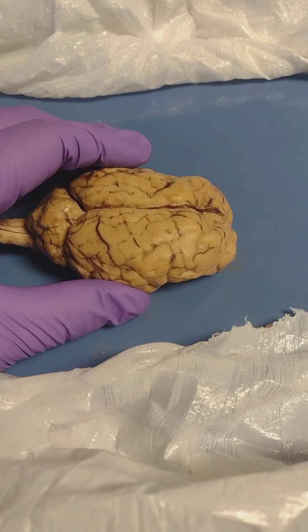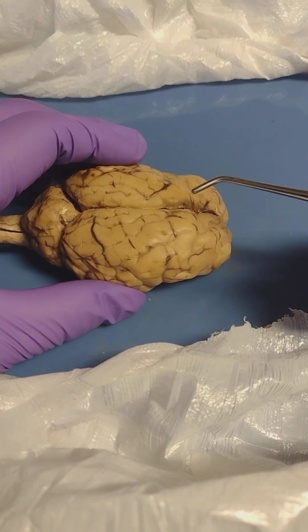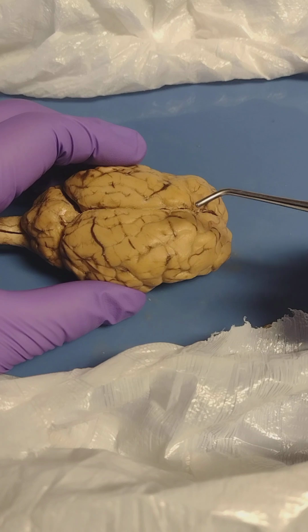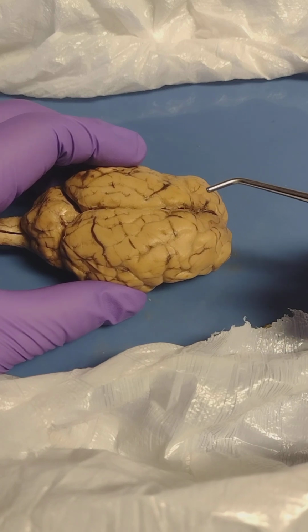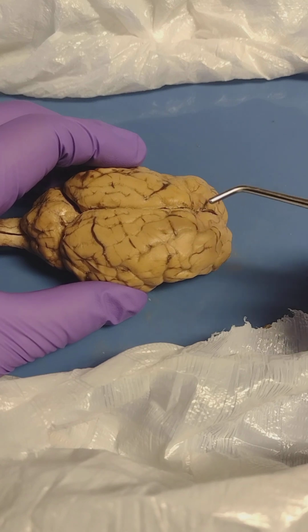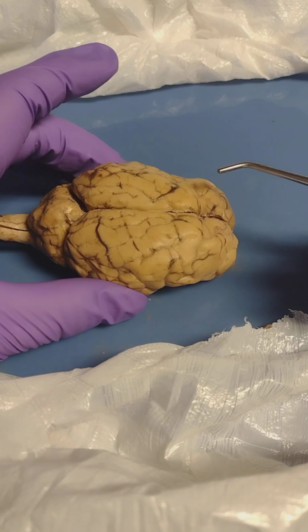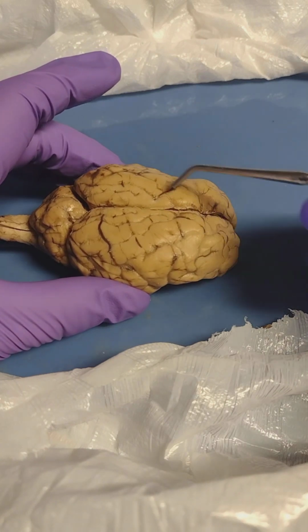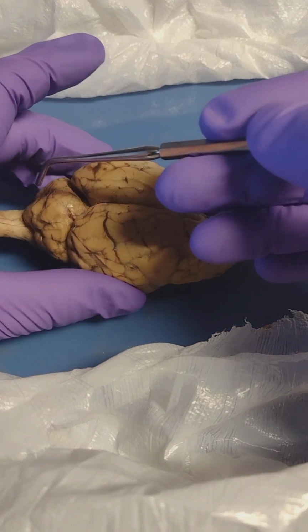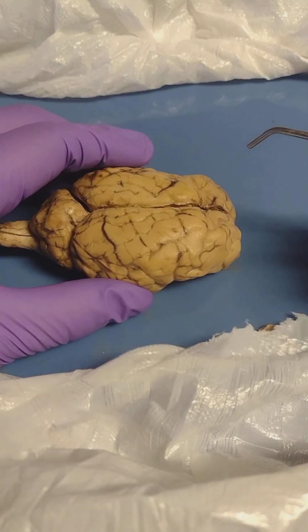for NDSCS. Here we have a sheep brain, and although not shown, it would be covered by three meningeal layers. Going from superficial to deep, you would have the dura mater, the arachnoid mater, and the pia mater. As you can see, the brain is made up of three main structures. Here you have the cerebrum. Back here, you have the cerebellum. And then underneath, you would have the brainstem, and we'll get to those later.